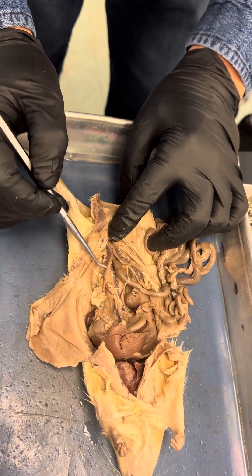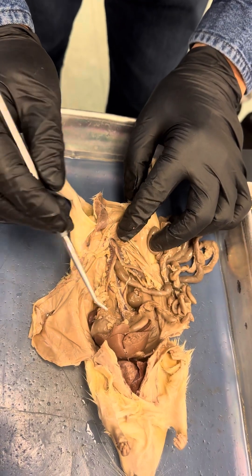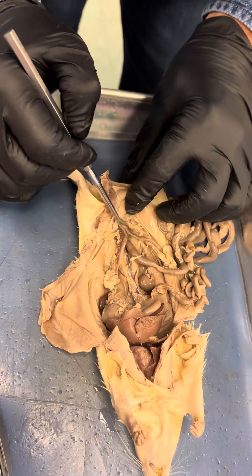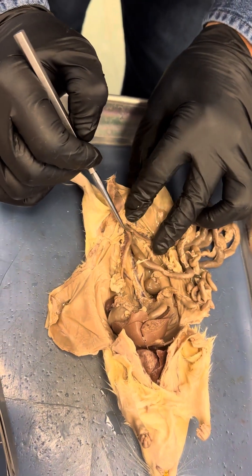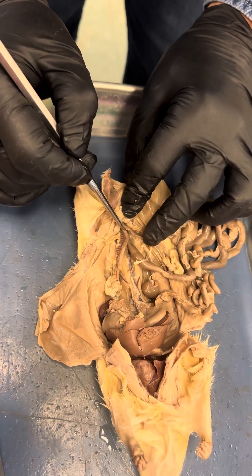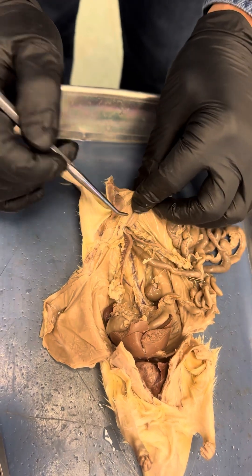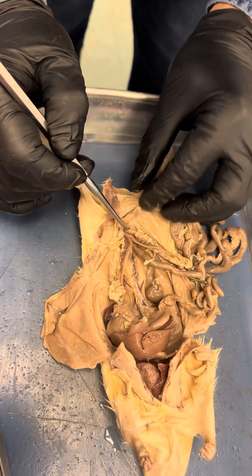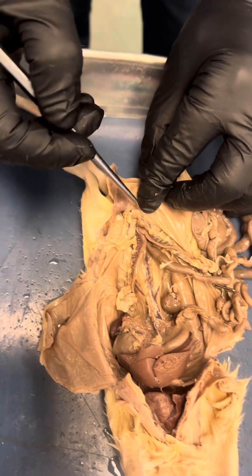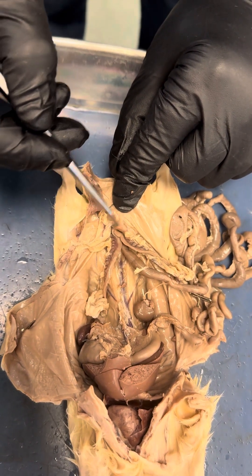Do you see some tiny structure? The fetus will grow up here. If she's pregnant, we can see the fetuses also. The right uterine horn — this one is the fundus right here. And after that it will open through the birth canal. And this one is the urinary bladder. Remember, the urinary bladder is anterior to the uterus. So this is the urinary bladder right here. If they point to it during the exam and ask what is this — this is the urinary bladder.